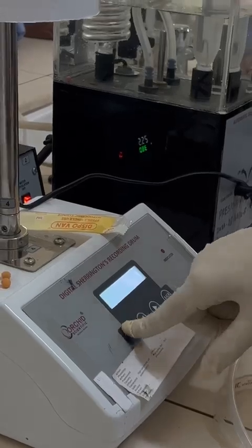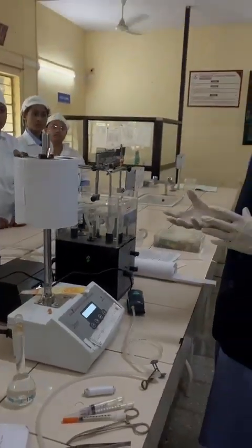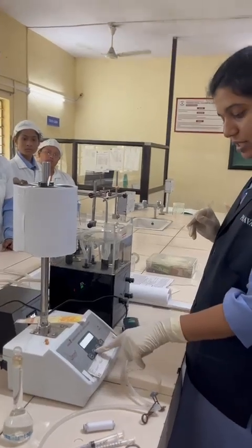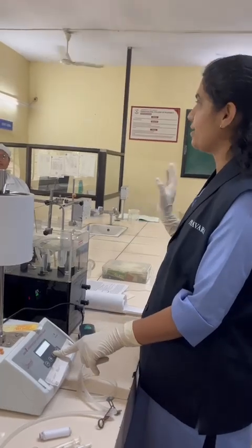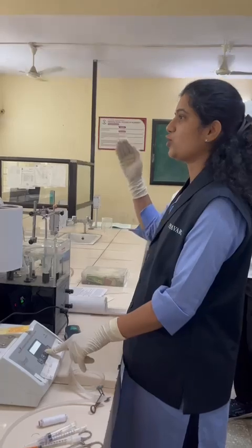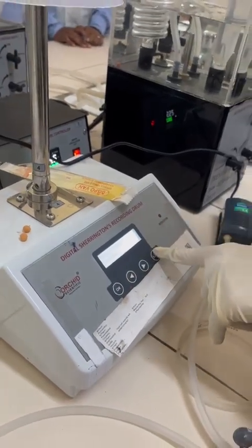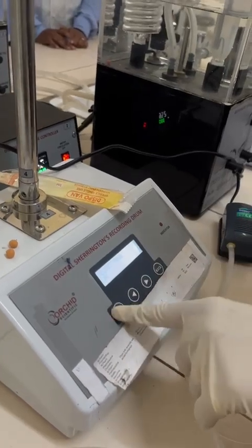What are those settings? Firstly, the buzzer on mode will be there to give some response or indication that now the contact time is over, the baseline is over. So we have to select between two modes: the CRC mode and the normal mode. Normal means you can take many responses. In CRC, up to the saturation level, there will be a normal gradual increase in the dose. So for the beep interval, you can select the buzzer mode on, then CRC mode.